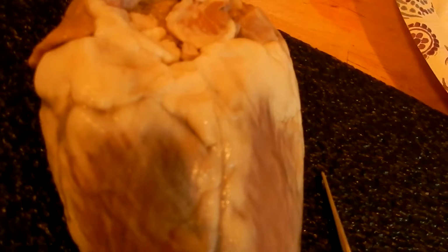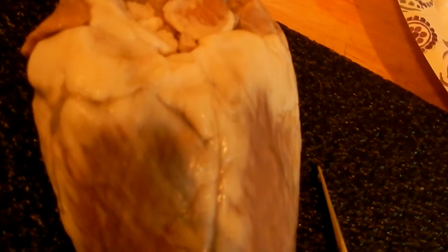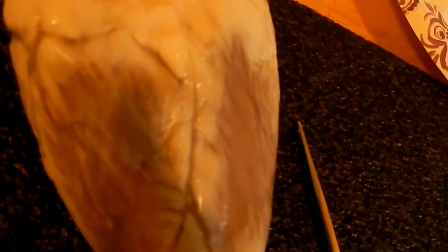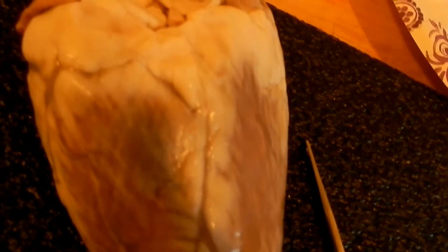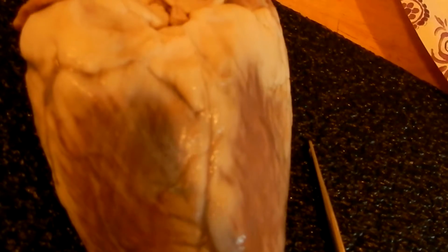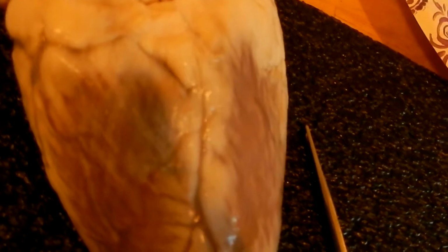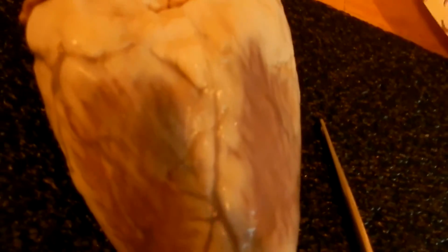Alrighty. So the coronary circulation also consists of the blood vessels that supply blood and remove blood from the heart's tissue. So that's also important, another little housekeeping tool there. And when we do the dissection, I'm going to show you a few other things. So let's go ahead and cut to the internal dissection of the heart. And we'll look at the tricuspid and bicuspid here. So we're going to do a lateral cut here.